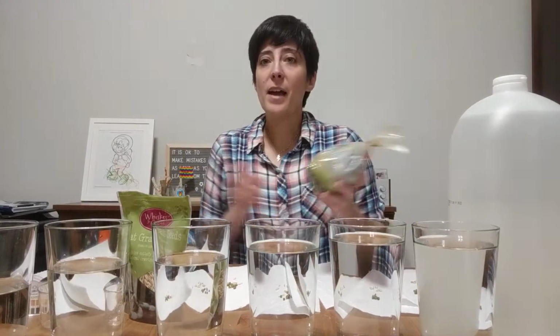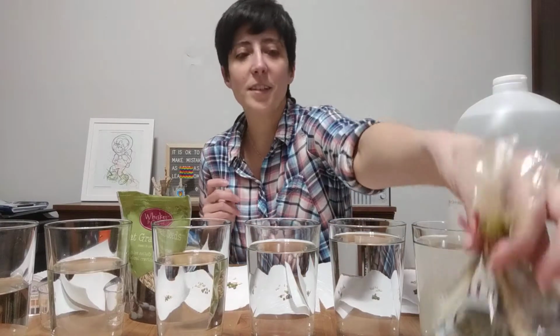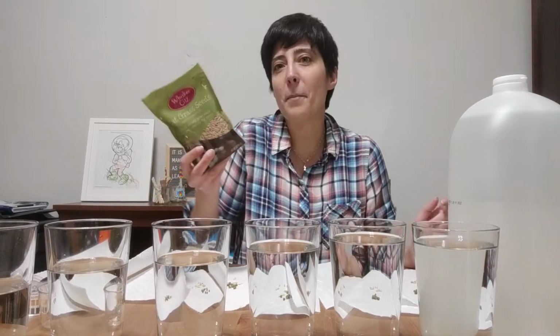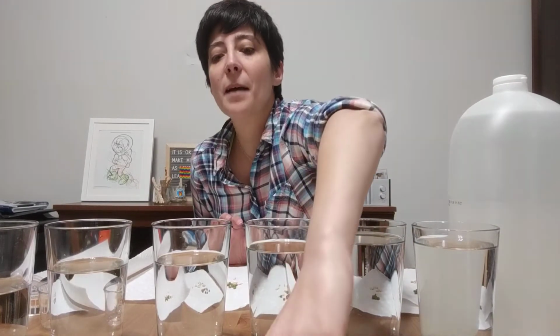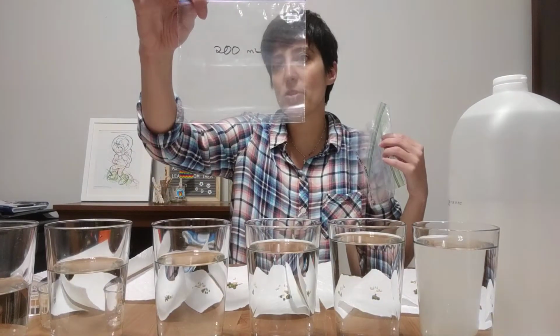For today's lab, I have two different kinds. I have mung beans, which you can't really see the label on because I've used it a bunch for last year's lab also. And then cat grass, because I'm at home and I have a cat, and so I have cat grass seeds. You may notice as I'm putting things in the bags, I'm labeling them based on the amount of vinegar I'm adding. So this one says like 200 mils.